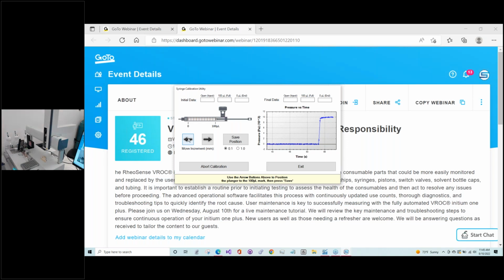All right. And then I am satisfied with where the position is at. So I will hit save position. And it will continue to do the rest of the calibration. Yeah, and if it is really hard to see in your lab, either due to your vision or maybe it's too dark, I've in the past used the camera on my phone to zoom in, or if you're sort of OCD and you like to be super accurate, then that works too.